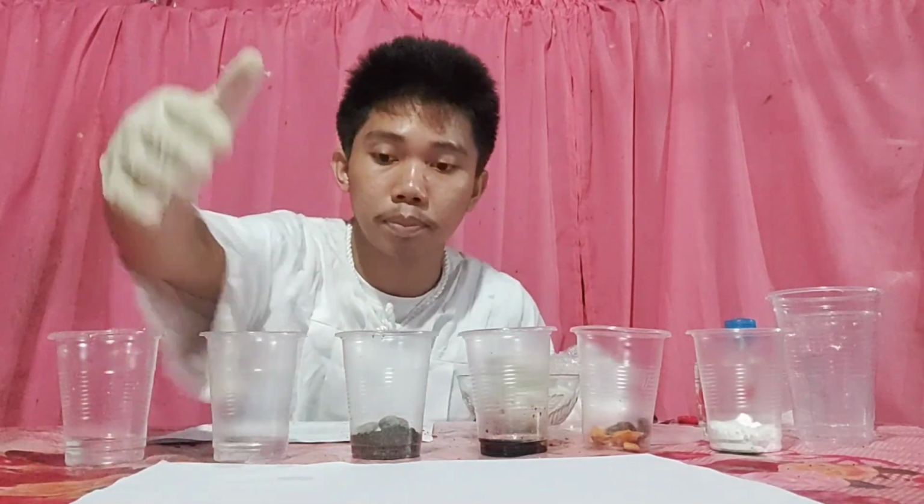As I said earlier, for our solid mixtures, we will transfer them onto our bond paper.